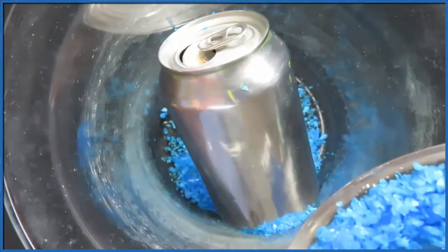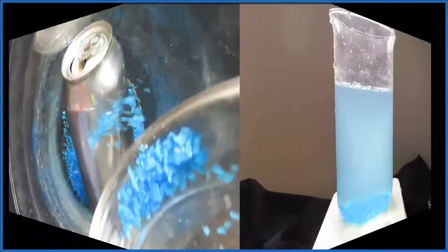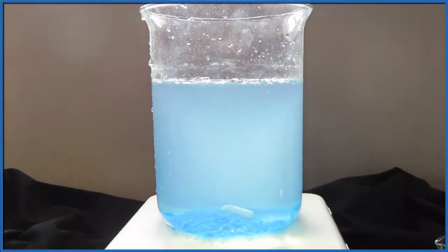Okay, that was a little bit disappointing. We probably need to add the copper-2-sulfate to water, to dissolve it in water and make it aqueous, so those copper-2-ions can react with the aluminum. Let's do that.